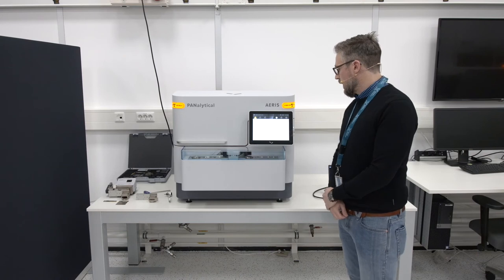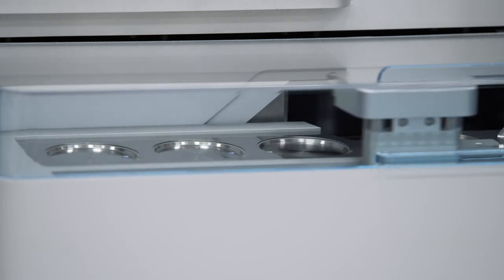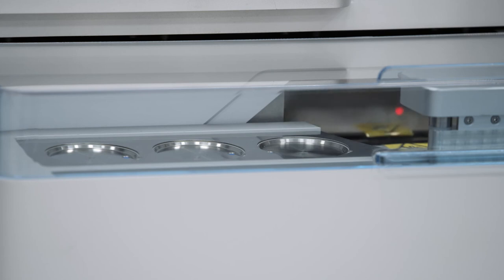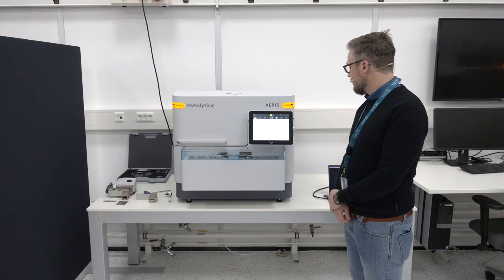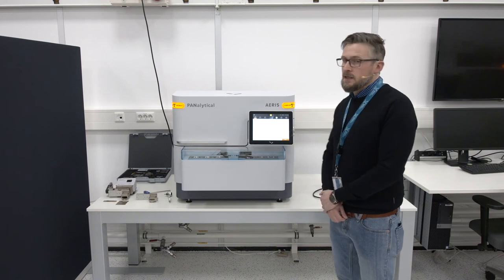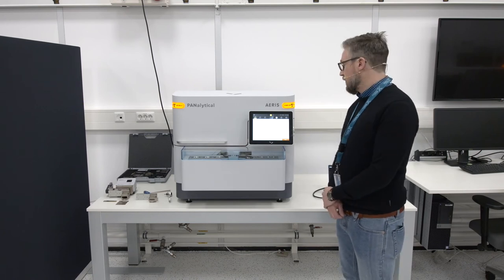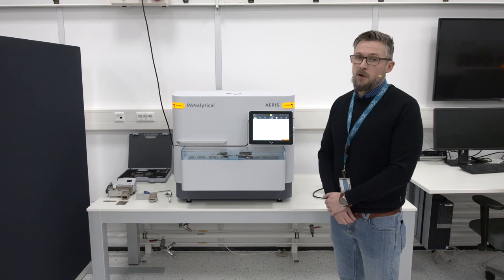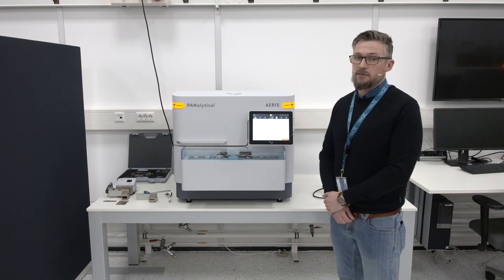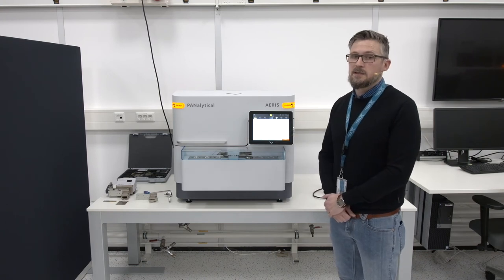I press continue and the gripper picks up the sample and introduces it into the instrument. The measurement now starts. For convenience we decided to speed up this measurement because it is 16 minutes long, so you will see the live data being recorded slightly faster than in real time. You can still follow the timer at the bottom to confirm that the measurement time is indeed 16 minutes.